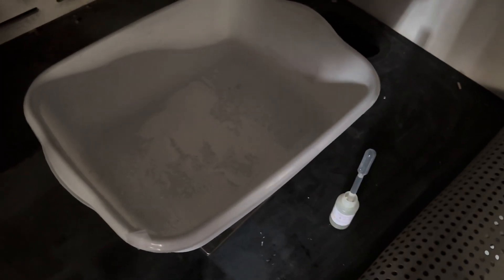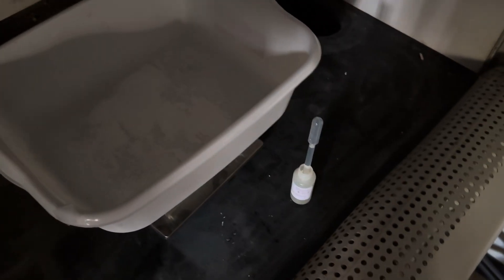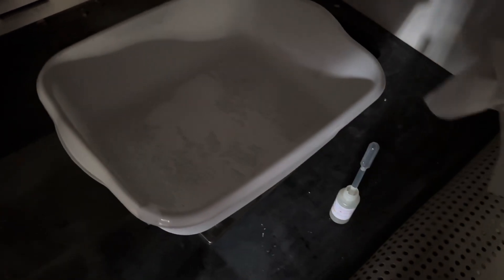Oh, I feel something burning on my finger. Oh, shit. That might not be good. Okay. Alright. So, anyway, we put, as you saw in the timelapse. Geez. I need gloves. There's some stuff on that. Alright, take two.